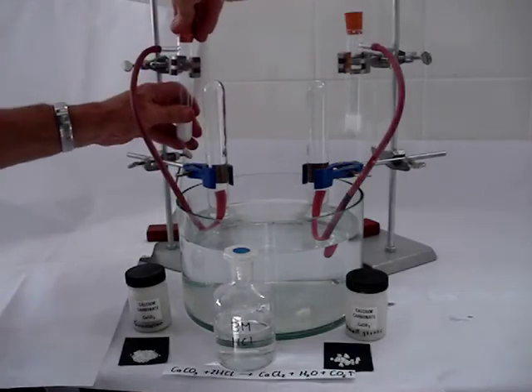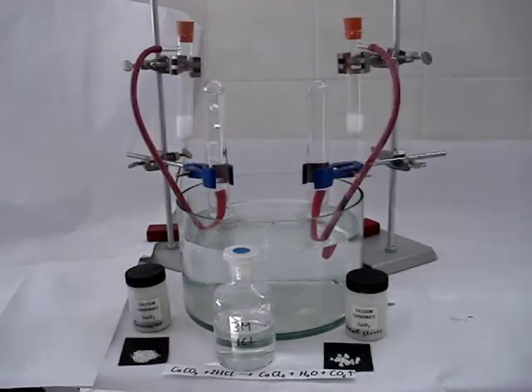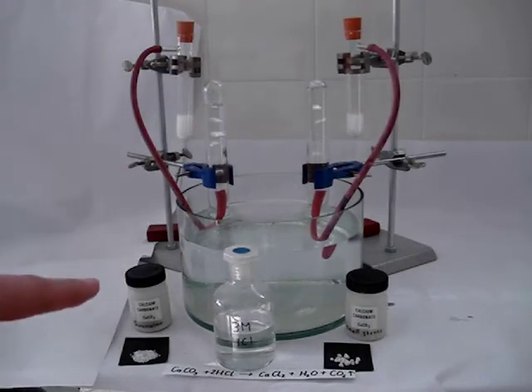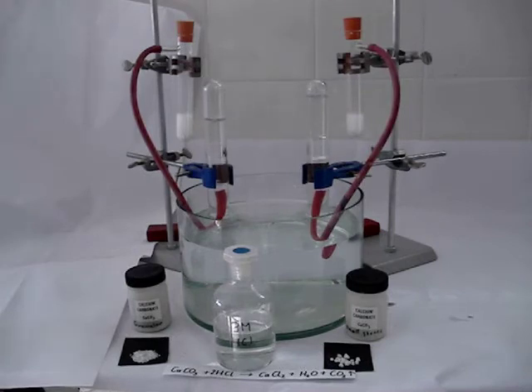Notice the bubbles formed. We can immediately see that in the case of the granular calcium carbonate, there are more bubbles produced per time.